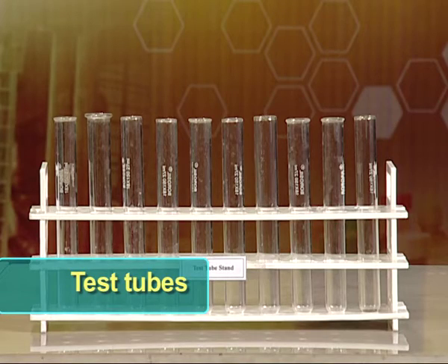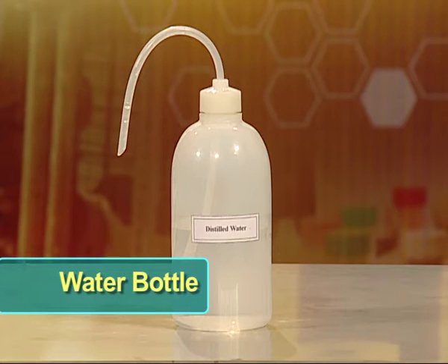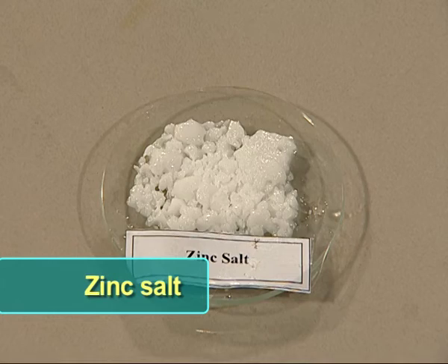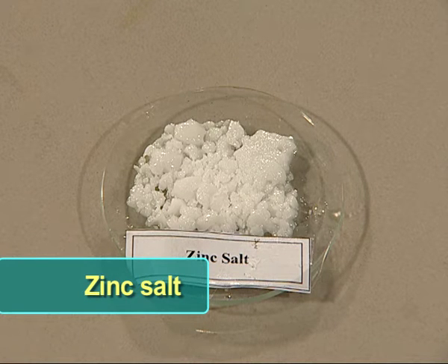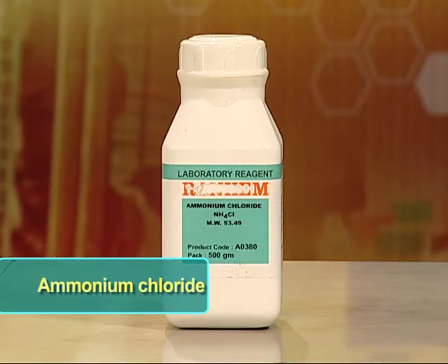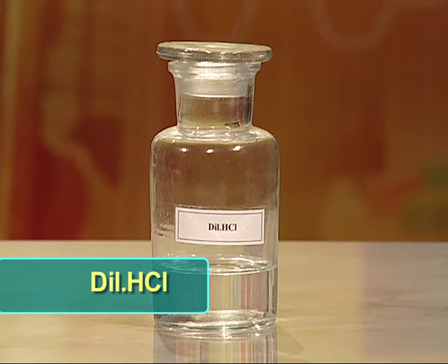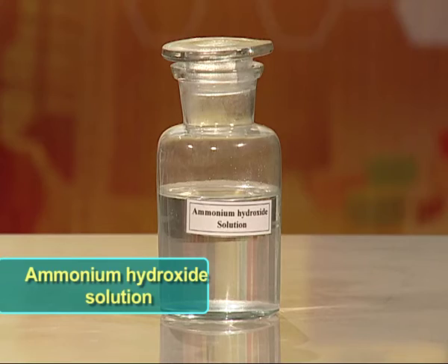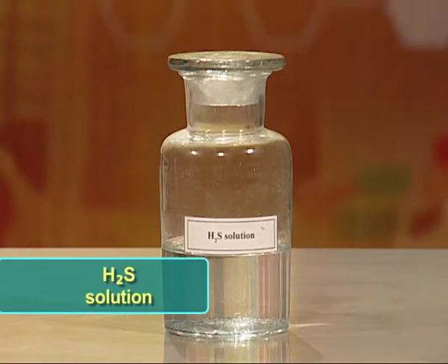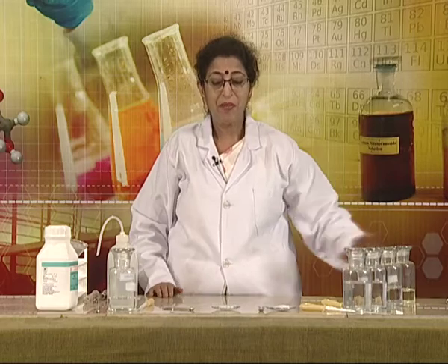Materials required are: test tubes, test tube stand, funnel with filter paper, water bottle, test tube holder, spatula, droppers and watch glass. Chemicals required are salt of zinc and salt of manganese. Besides this, we need solid ammonium chloride, dilute hydrogen chloride solution, distilled water, ammonium hydroxide solution, sodium hydroxide solution, hydrogen sulfide solution, and the reagent potassium ferrocyanide.